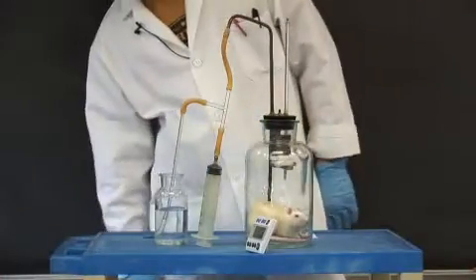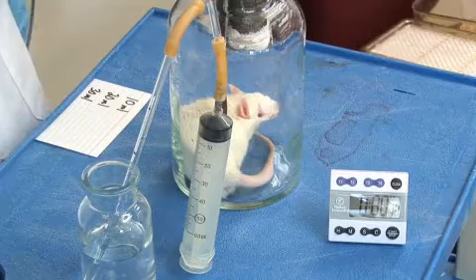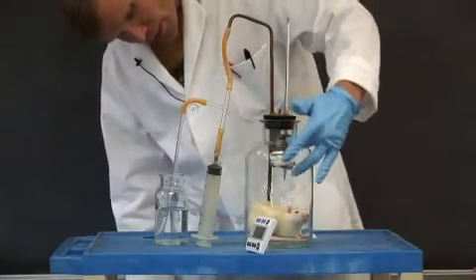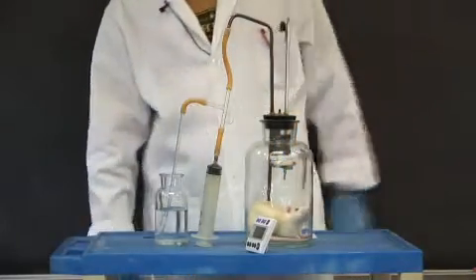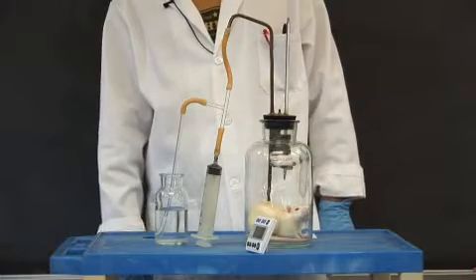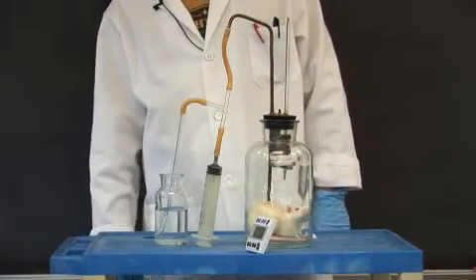So now the rat's in the sealed chamber, breathing, consuming oxygen. The small pot that has gauze wrapped around it has soda lime in it. That will absorb the CO2 that the rat evolves. Thus, there'll be a net reduction in air pressure as the oxygen is consumed.